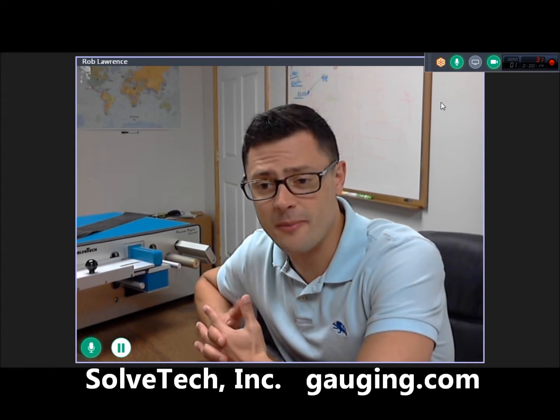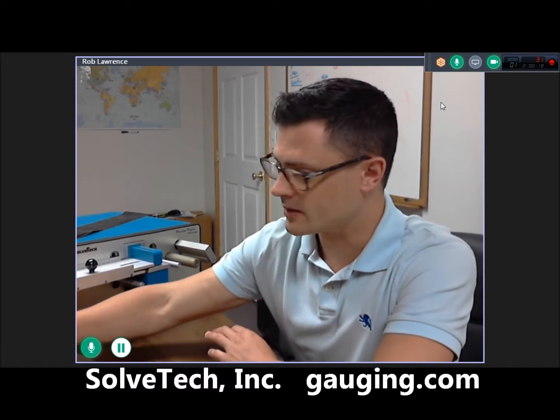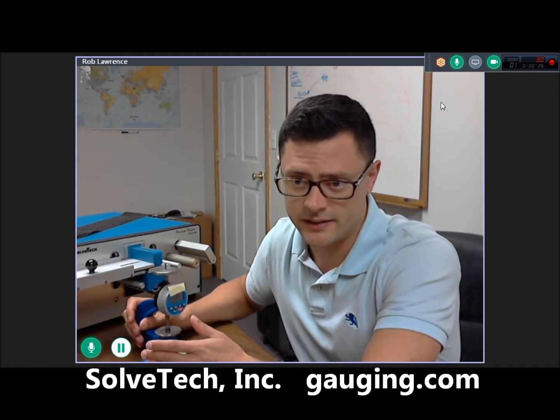So today I'm going to talk about measuring plastic film. SolveTech, we're experts in measuring plastic film. That's the core of our business. So I'll talk a little bit about that. Contact method versus a non-contacting method.